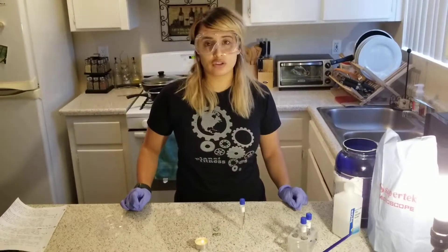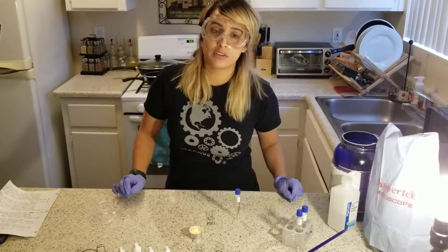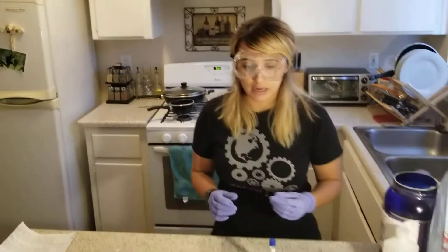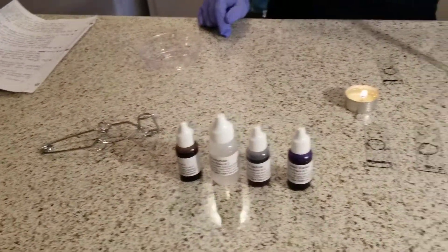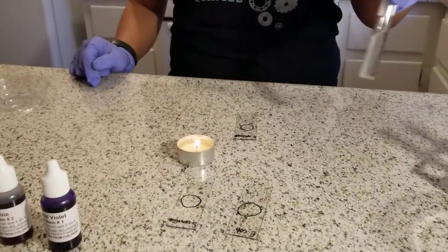Alicia Coda. This is Bio 225, Week 3. Today's date is 5-24-2018. This experiment is in bacterial morphology and staining techniques. In this lab, I will be preparing bacterial smears via gram stains using pure samples from broth inoculated in the previous experiments.